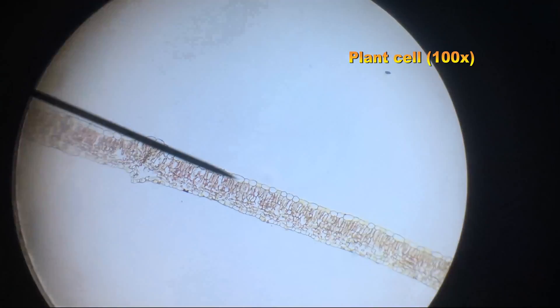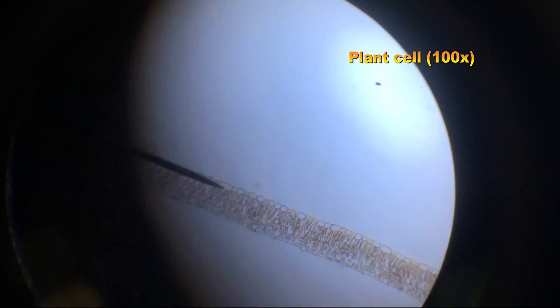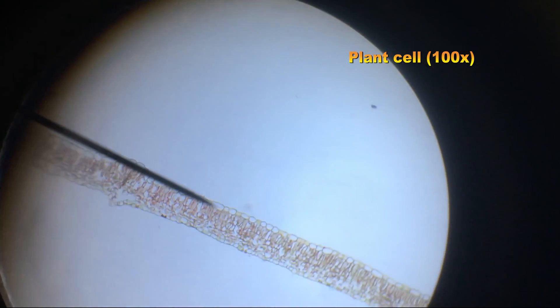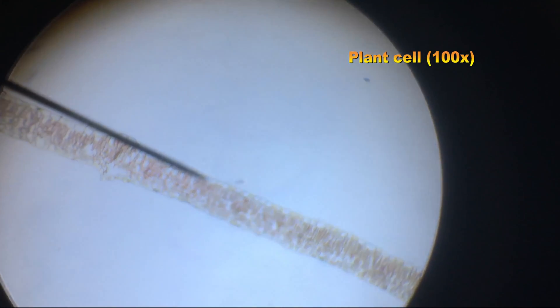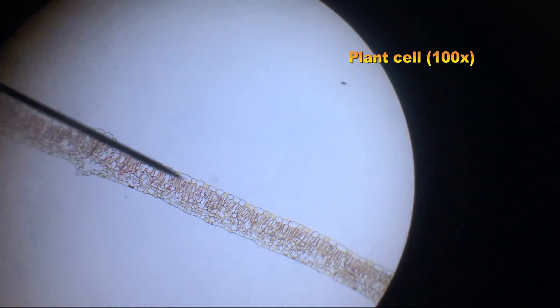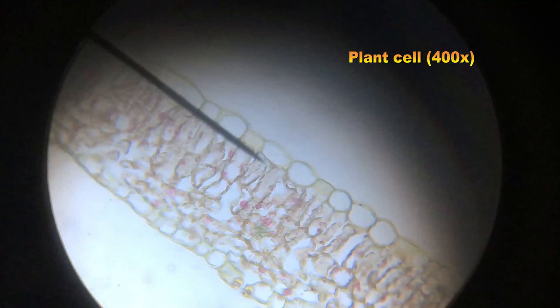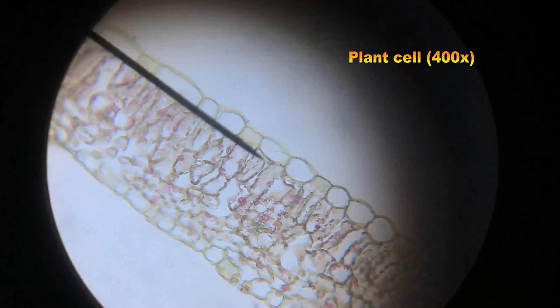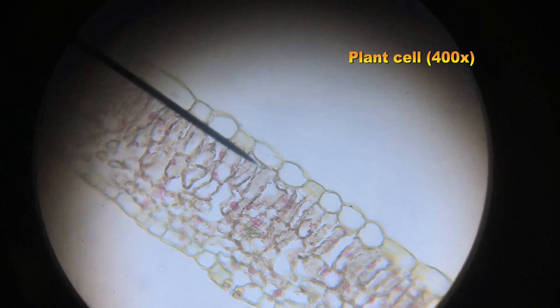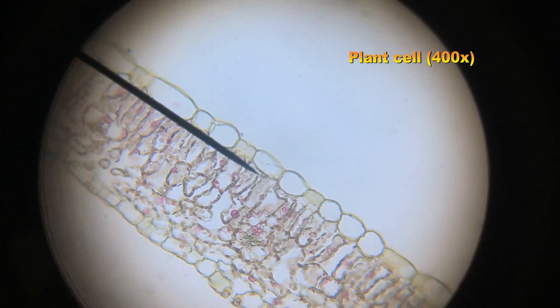Here it is on low power. You can start to see the different cell layers, and we'll be looking at cells in this second layer from the top. And finally, here it is on high power. Clearly, cells in rectangular shapes are visible. Again, we're looking at the cells in the layer second from the top.